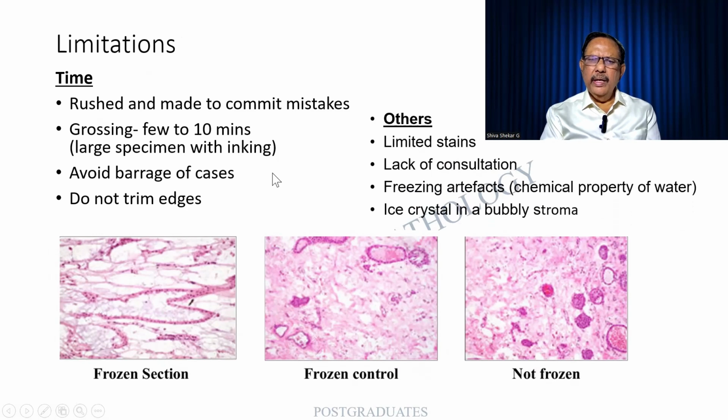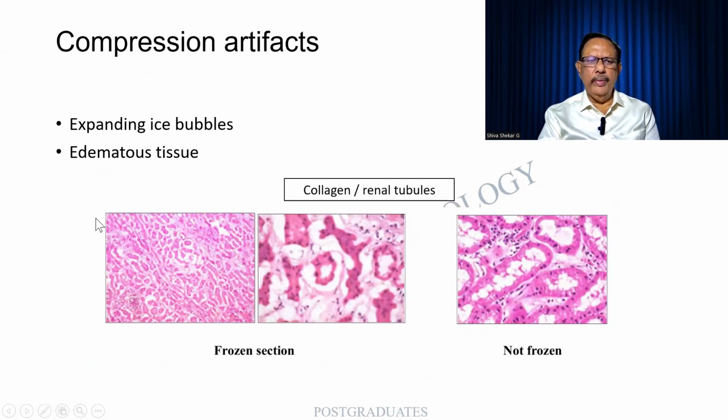Limit the stains, and then there has to be a consultation with the clinician. Freezing artifacts are to be avoided. Ice crystals can lead to a bubbly appearance. A compression artifact is also there because of the expanding bubbles or the edematous tissue. This is collagen over here, and this is the renal tubule. Look at this one, this is not frozen. There is so much difference in the morphology. How can I give a report on this section?